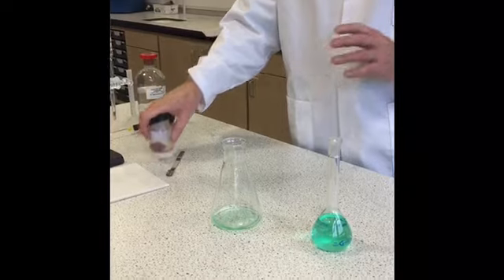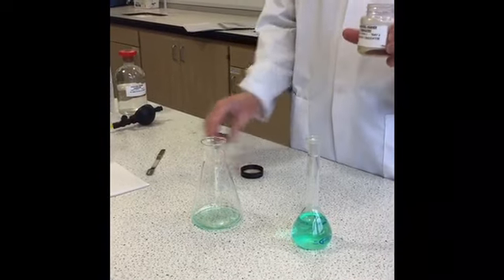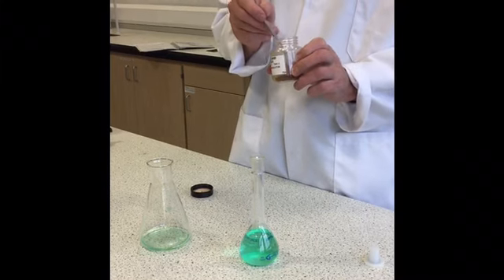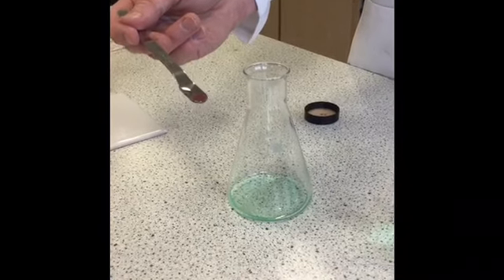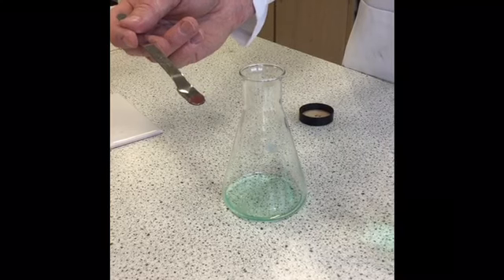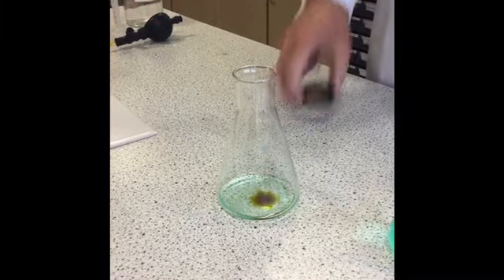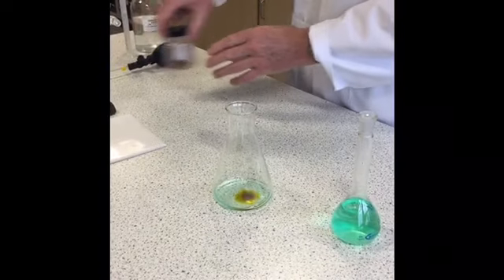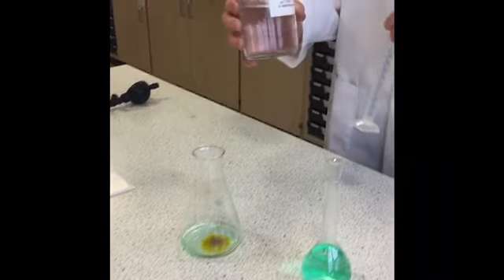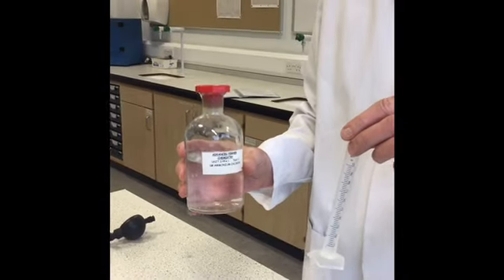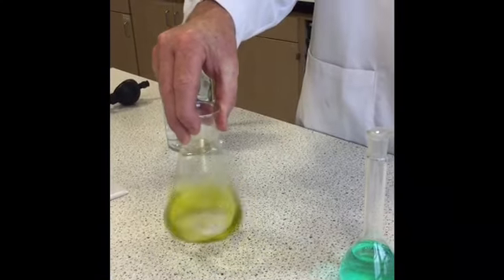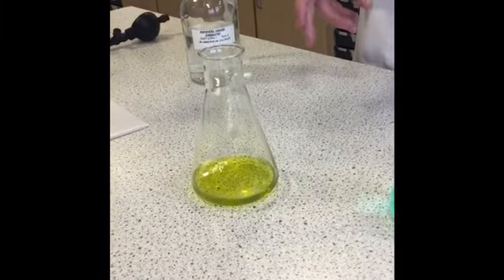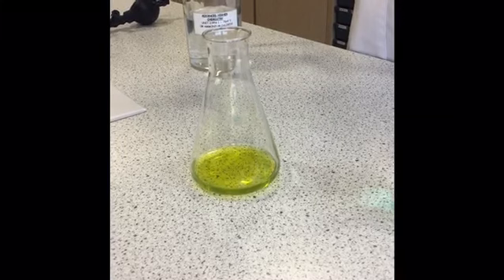We then add very roughly 0.05 grams of our murexide which is going to be our indicator for the titration. That's a very small amount, certainly no more than that. You don't actually have to weigh out 0.05 grams, just no more than that. Then we add 10 mils of ammonium chloride which can be measured out using a measuring cylinder. Give it a good mix and you see our starting colour is a nice yellow colour produced by the murexide bonded to the nickel.